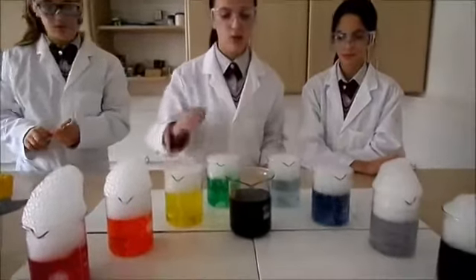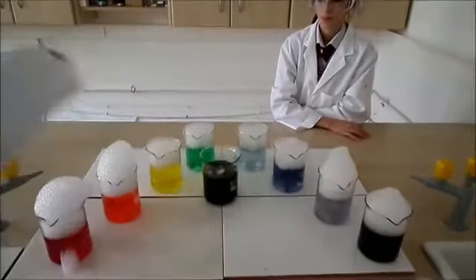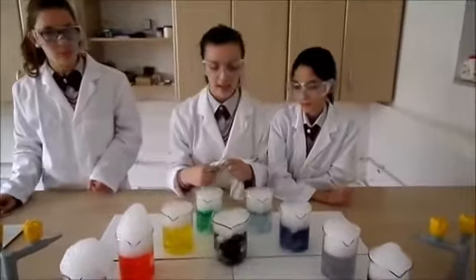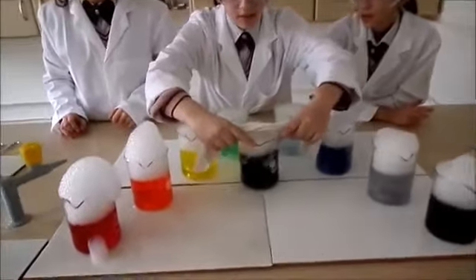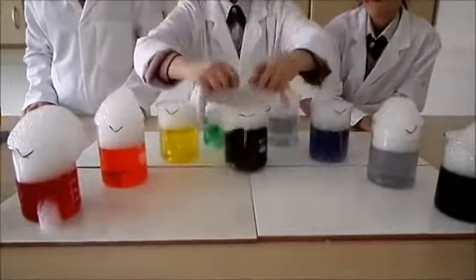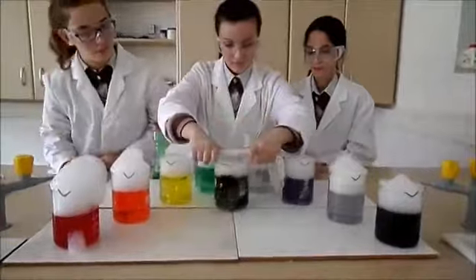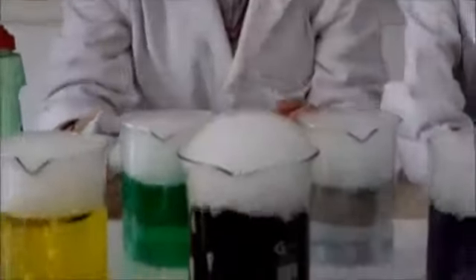We are now going to add dry ice to this beaker. The carbon dioxide coming out of the dry ice is much more dense than air, so as you can see, it is going downwards. I am now going to place a cloth over the beaker. As you can see, a bubble is formed, and the bubble is growing because it is filling up with carbon dioxide.